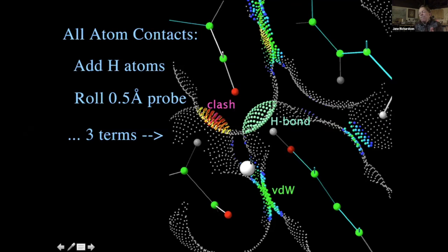And if it's far apart, if it's near to 1/2 angstrom, it's blue. If it's very close to van der Waals contact, it's green. If it overlaps very slightly, that's yellow. None of this is accurate enough to look at 1 or 2/10 of an angstrom. Atoms are not really spherical. Our numbers are not perfect, let alone the structures are not perfect. So we don't pay too much attention until we get to 0.4 angstrom overlap.